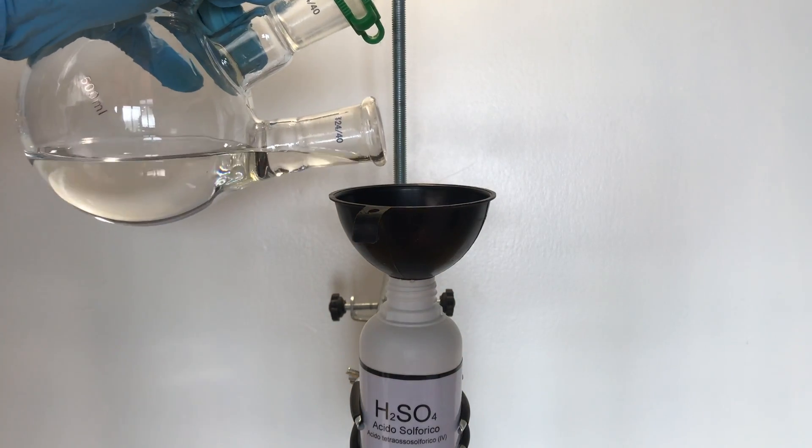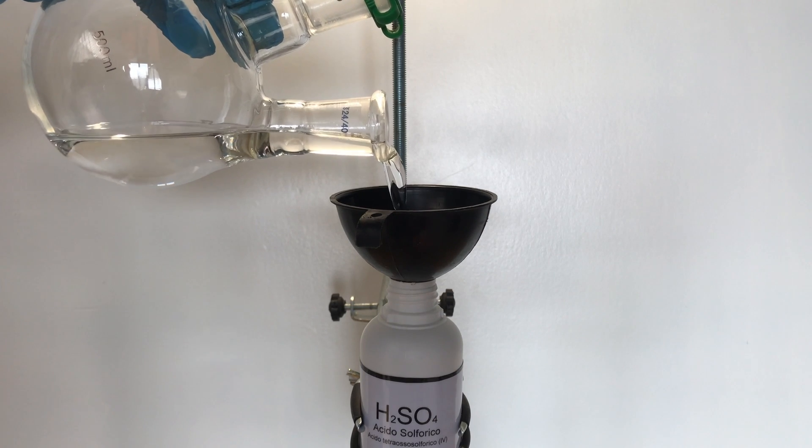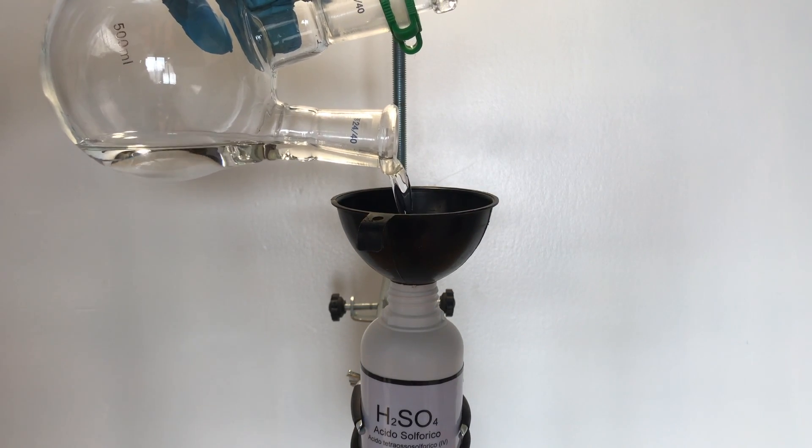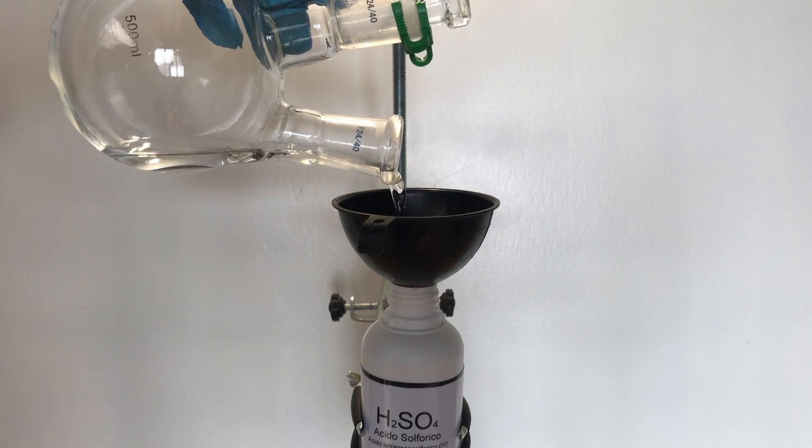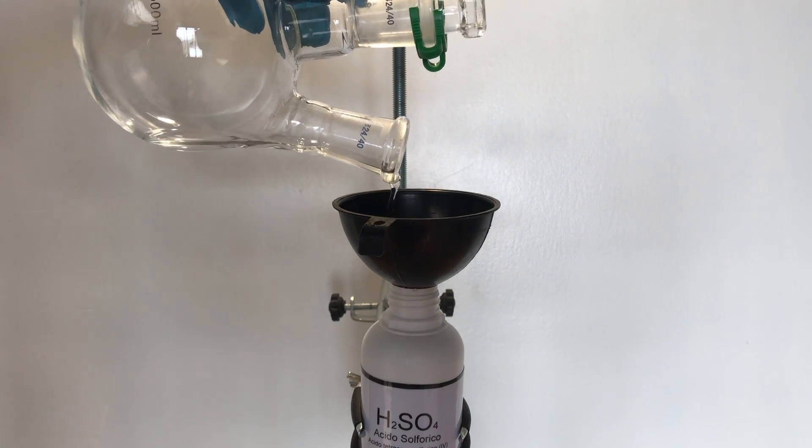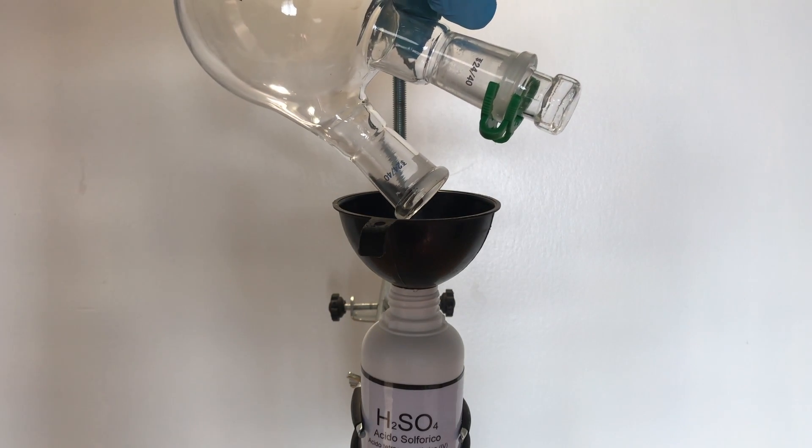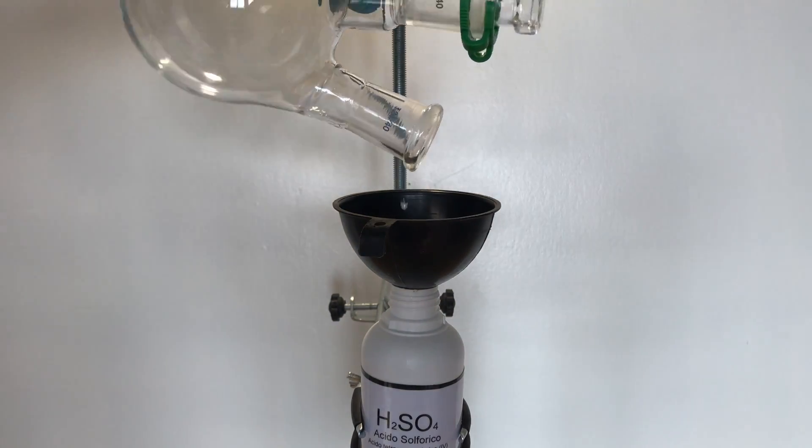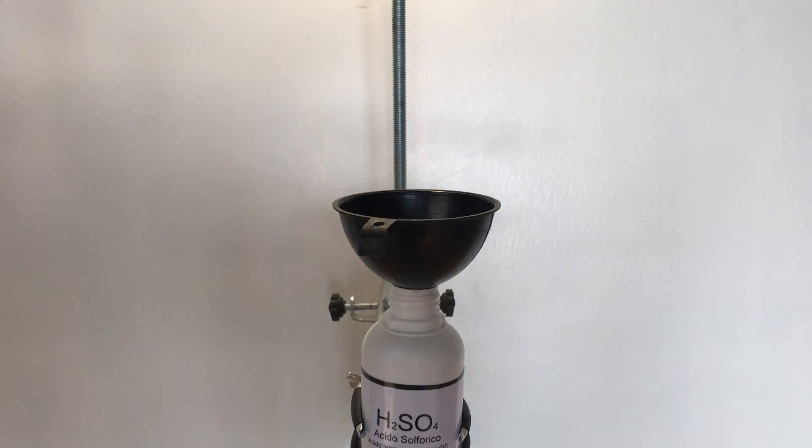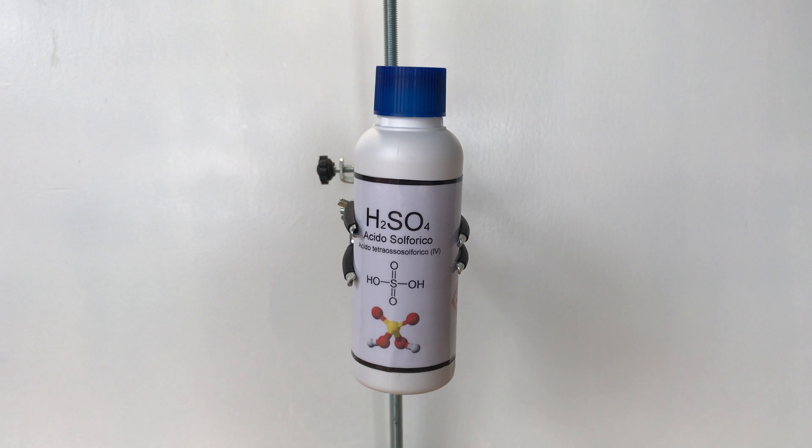Now we transfer everything into a bottle, already labeled, in HDPE. This is the final result.